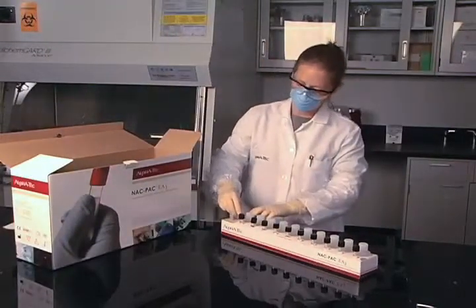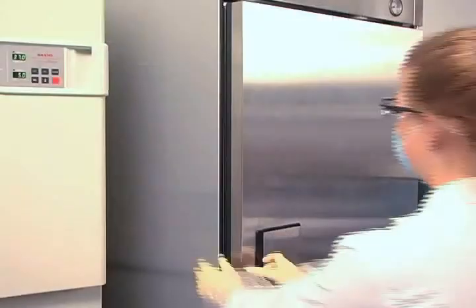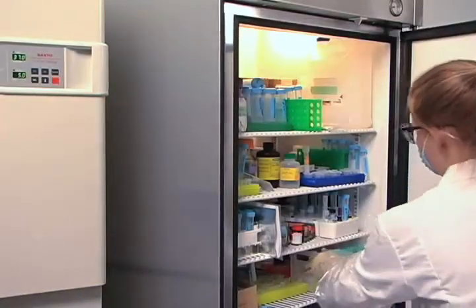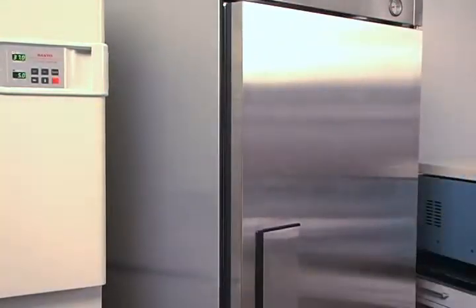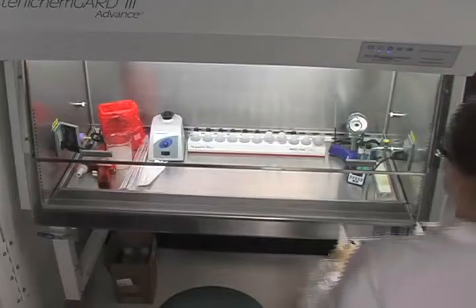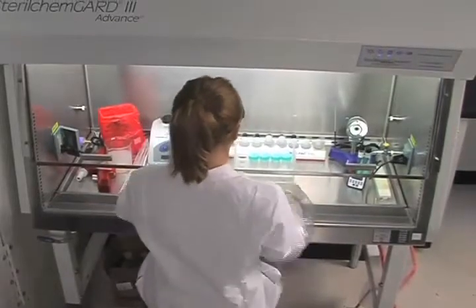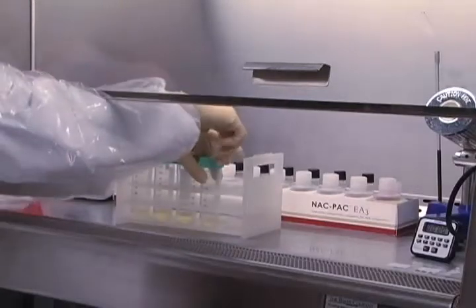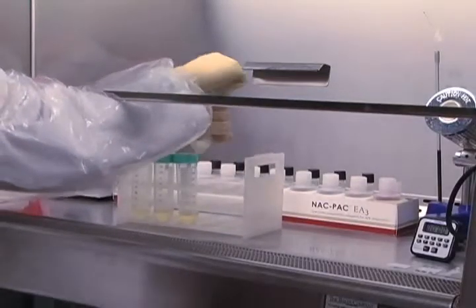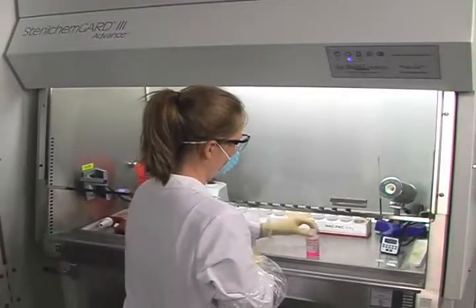Be sure that the proper volumes of reagents are available for the number of specimens being processed. Also check that the reagents have not exceeded their expiration dates and are not showing turbidity, precipitates, or other abnormalities. Allow reagents stored at refrigeration temperatures to reach room temperature prior to use. Line up the specimens in the biosafety hood, making sure to only process the samples that will fit in one centrifuge load. Open only one sample at a time, removing one specimen cap, adding the appropriate reagents, and recapping the specimen vial. This will avoid the cross-contamination caused by placing the wrong cap on a specimen vial.